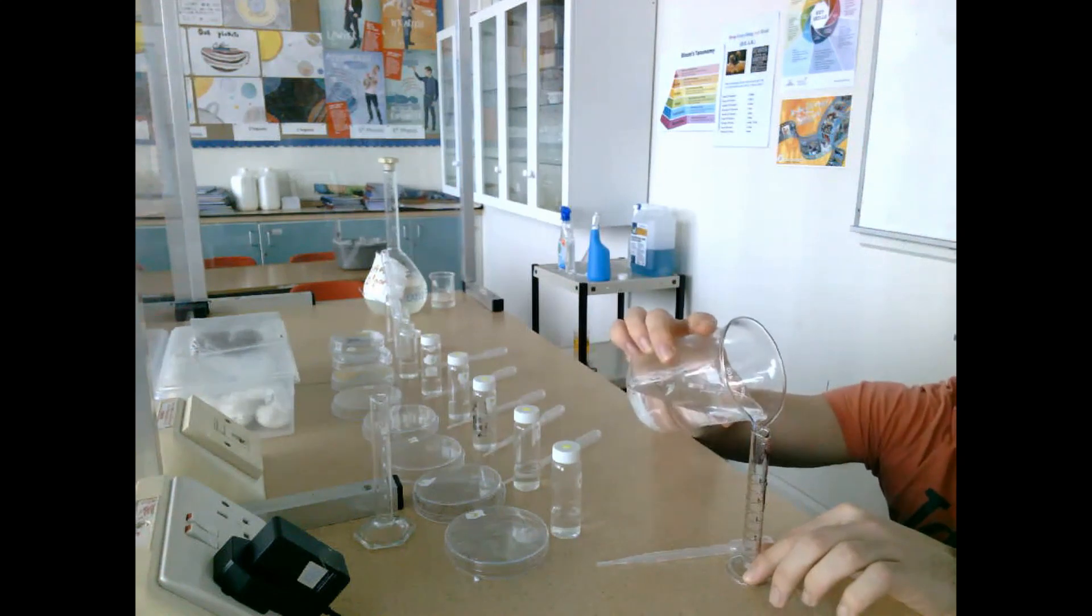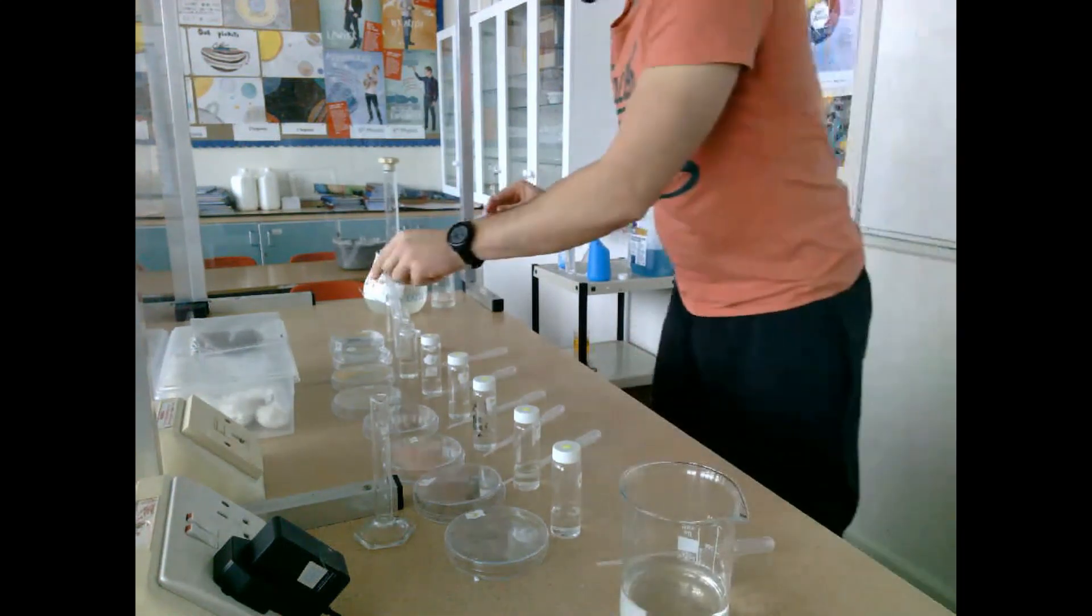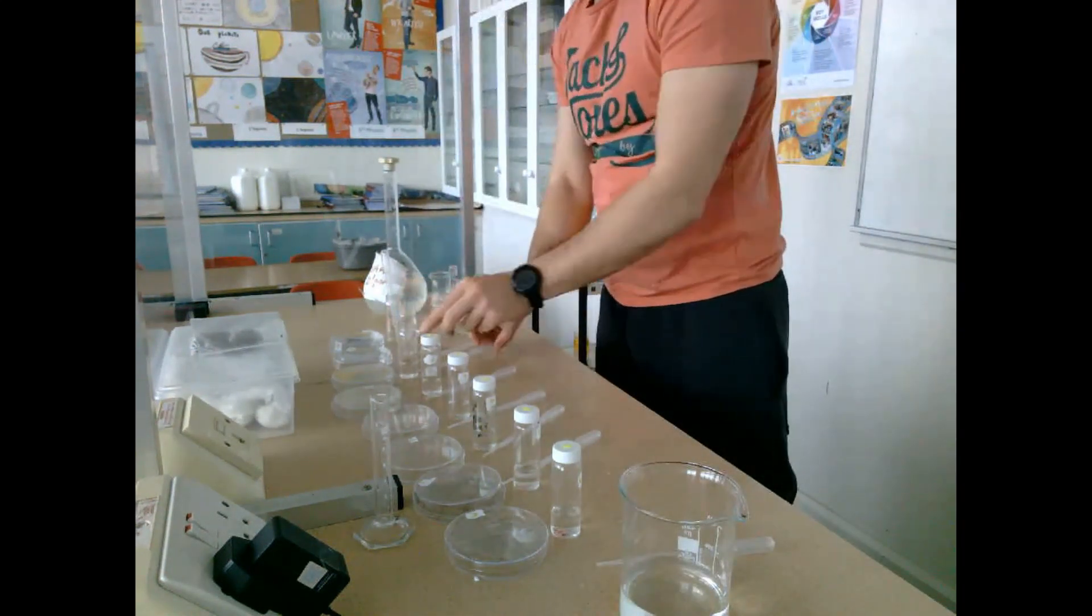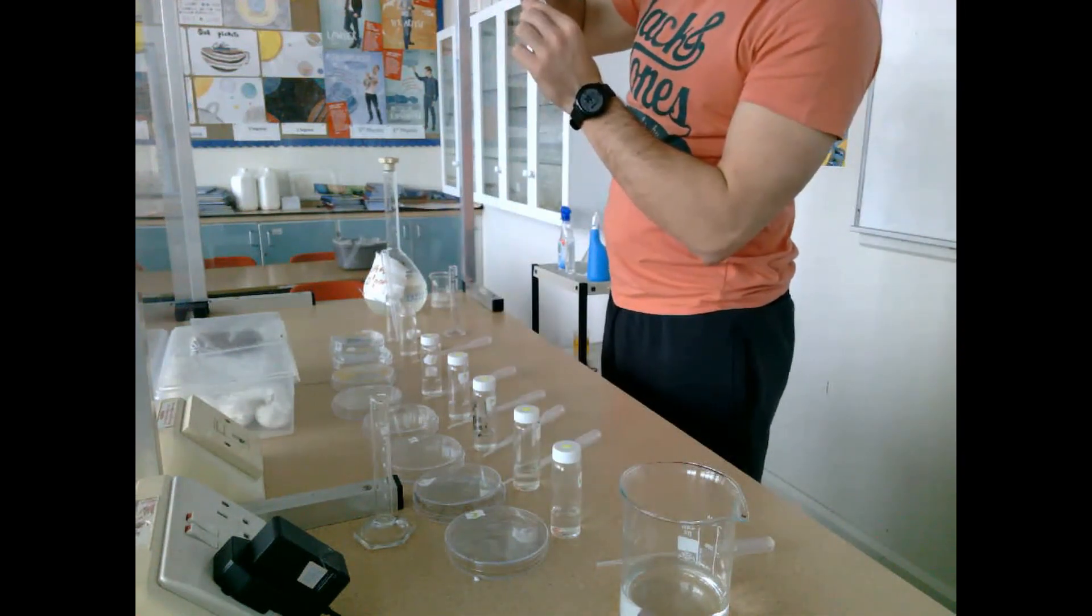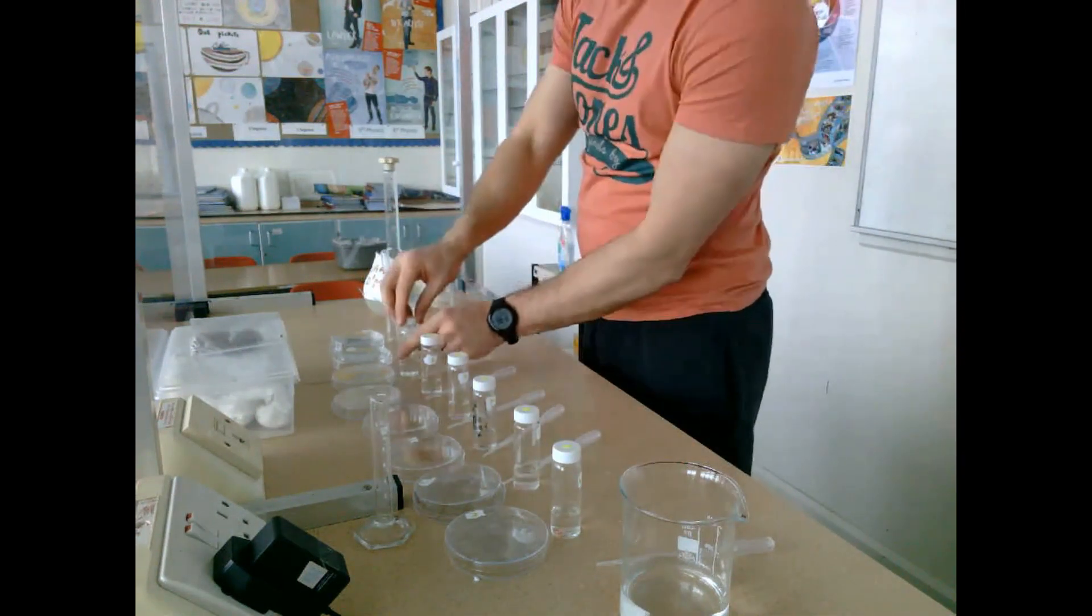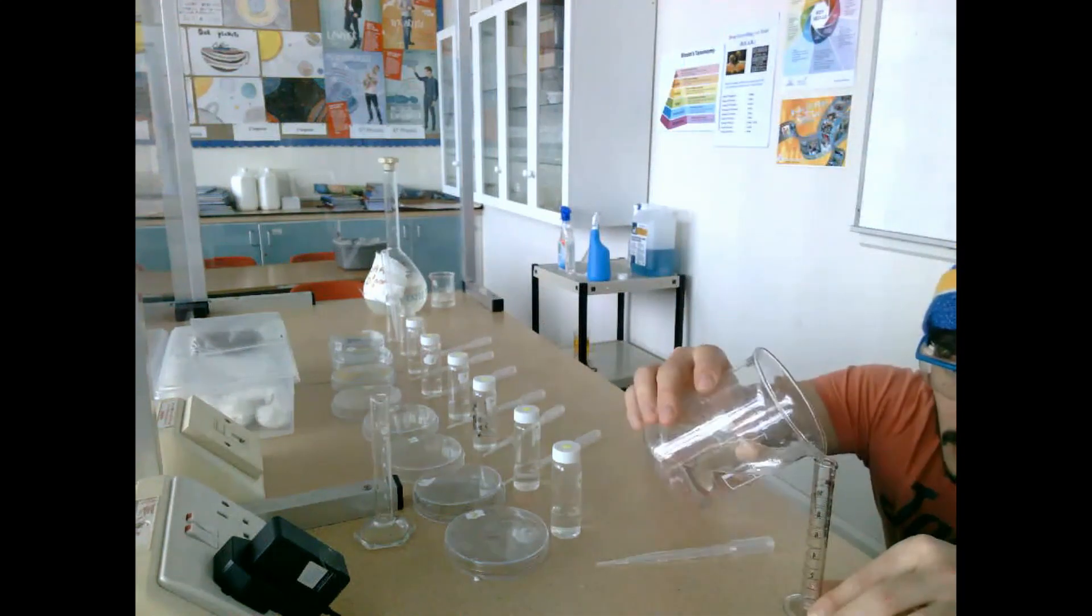We'll be left with a really low concentration in glass jar number eight in comparison to glass jar number one.